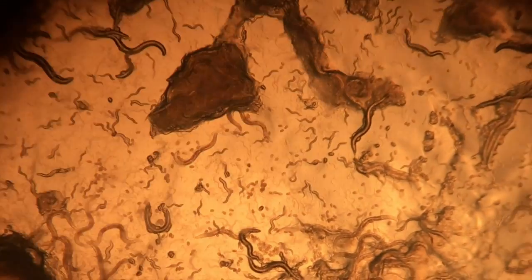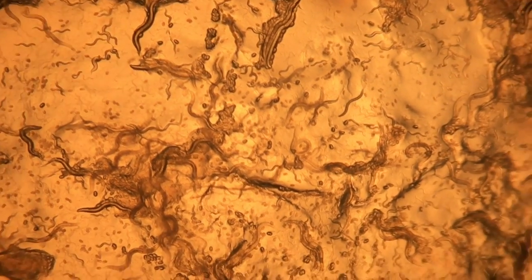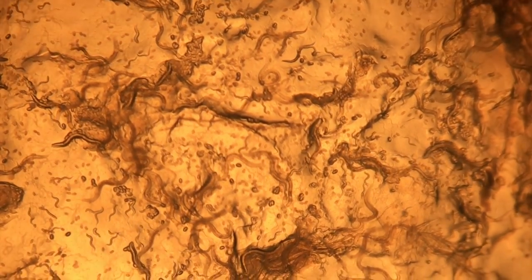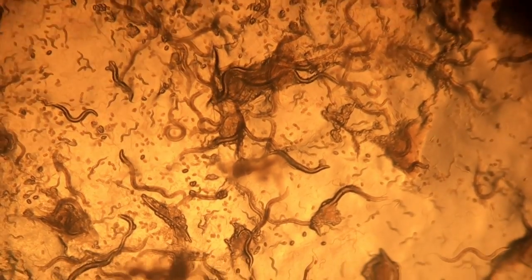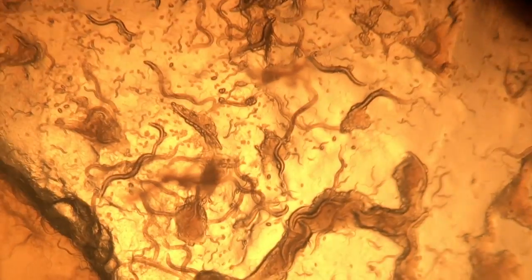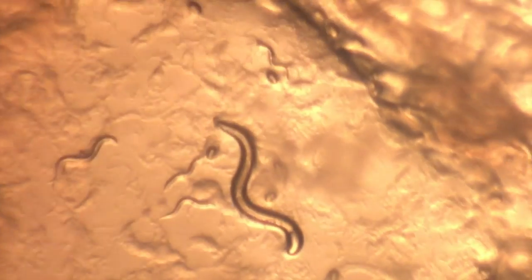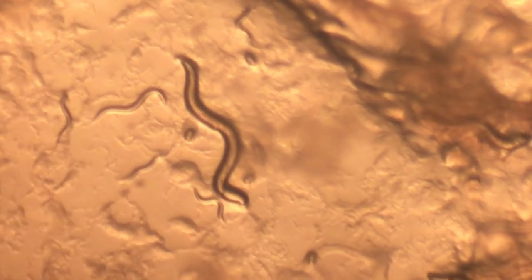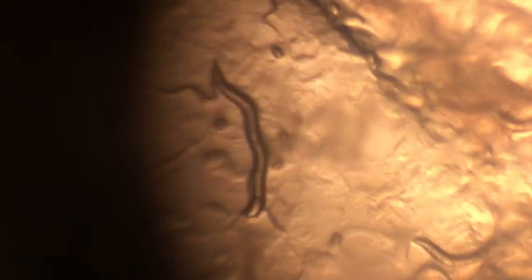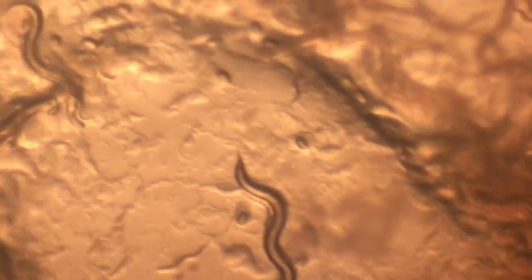The blisterings were primarily prevalent in the adult stages, which is usually when the blisterings get big enough to pop, causing death. As you can see here, the dead worms appear to be quite small and could even be mistaken for an adolescent worm, but this is due to the fact that after enough blisters pop, their inner fluids leak out, making them look smaller without it. Once blisterings have completely covered their bodies, they were almost entirely transparent. This blistering also induced slower and less efficient movement, as can be observed throughout the plate.